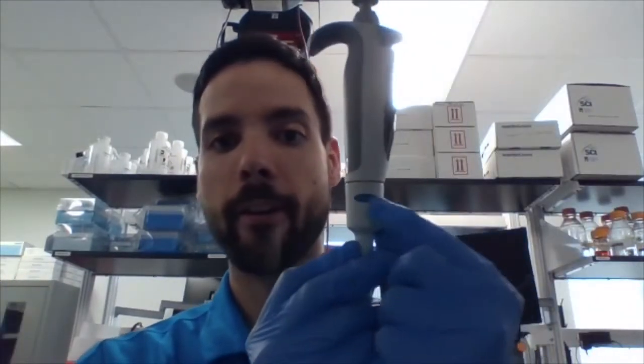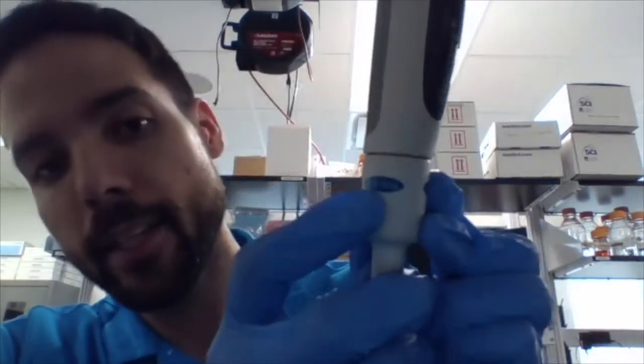The question then is, if I need to load 50 microliters, which of these should I use? So let's see that this is the closest pipette near you. You're about to load a sample, and this is the one that's right next to you. Question is, is this the right one to use? So 50 microliters. Let me go ahead and look down here and see what volume this is or what range of microliters this is. And you can actually see, this is the 0.5 to 10. Obviously, 50 is above 10. So I cannot use this. It hasn't been calibrated, nor is it able to pick up more than 10. I run the risk of breaking it if I begin to turn this up above 10.